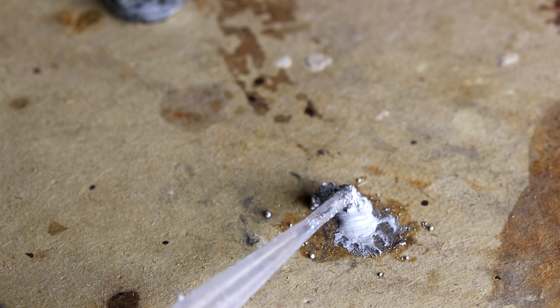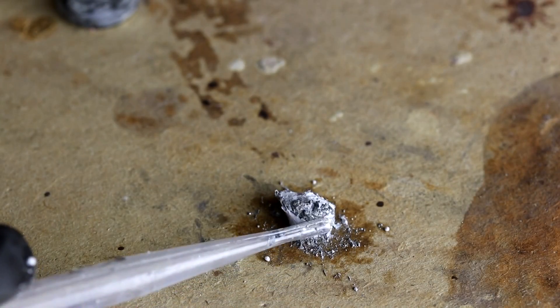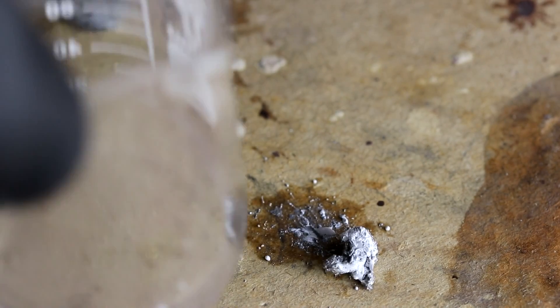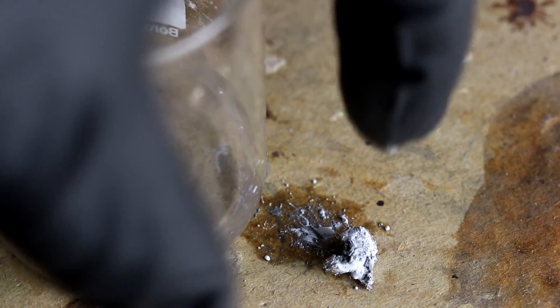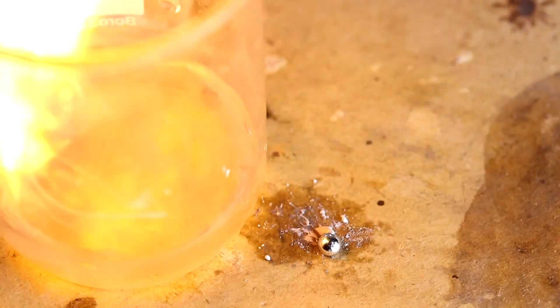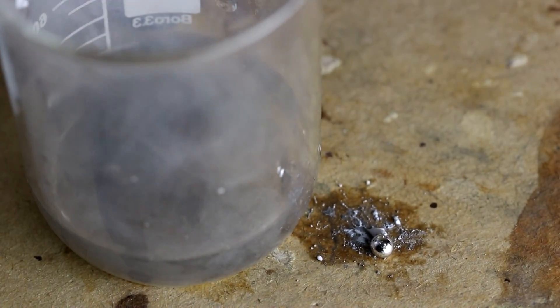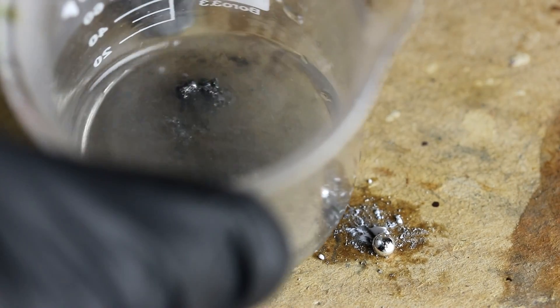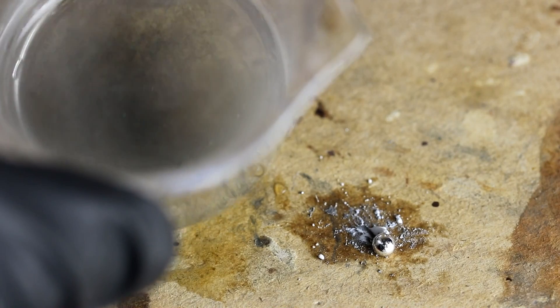Kind of mix them in a little bit. Oh yeah, it's solidifying. It's not completely solidified. You can see it is mostly solid now. Let's find out what happens if I drop it into some water. Let me pick it up. Oh. Well, it ignited and burned just like the liquid sodium would do.